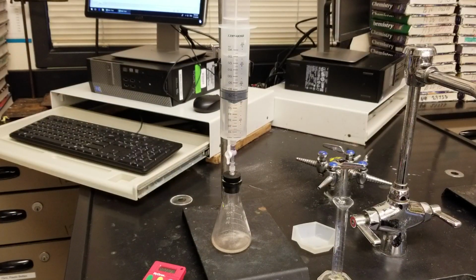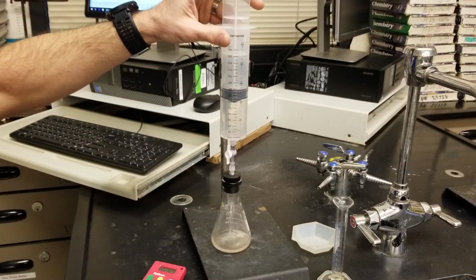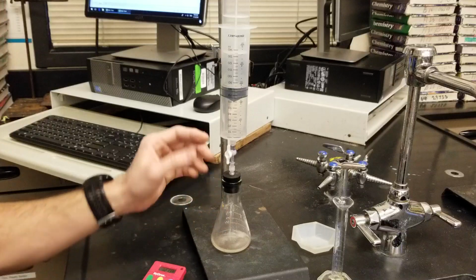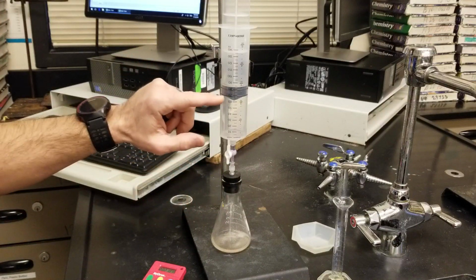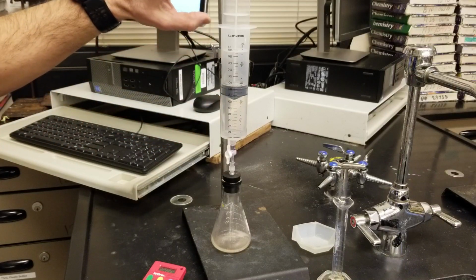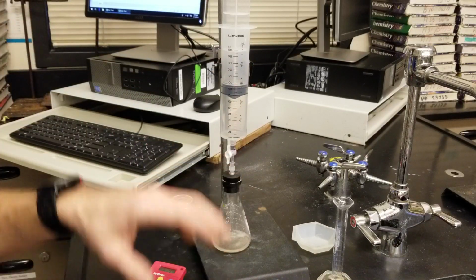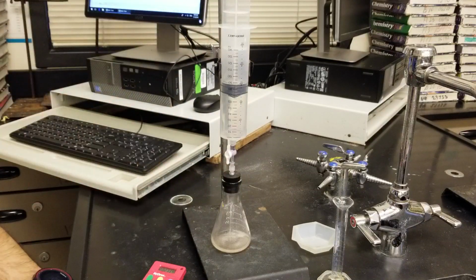All right, I've just hit the 2-minute mark. So again, before you take each measurement, push the plunger down a little bit because the plungers tend to get stuck. And then take your second measurement at 2 minutes. It would be really smart to push this plunger before your 2 minutes, maybe 10 seconds before your minute mark for each of the minutes up to 10 minutes, so that you can get a more accurate measurement.